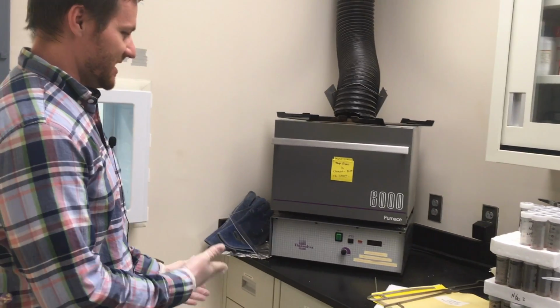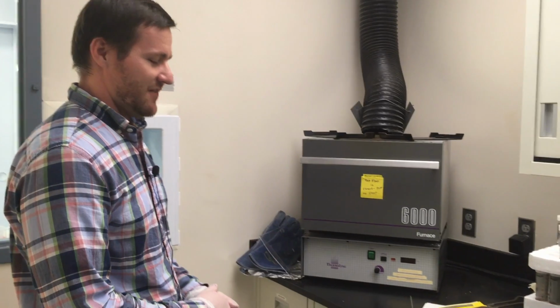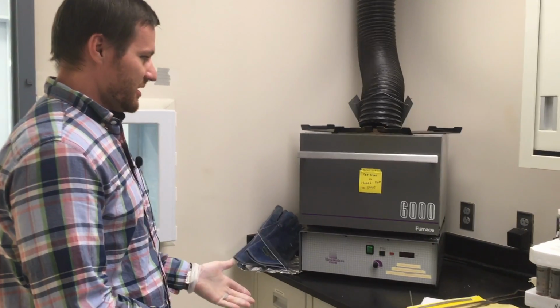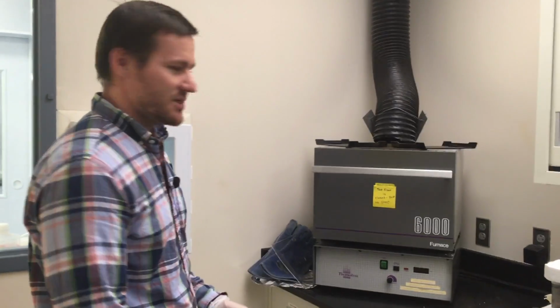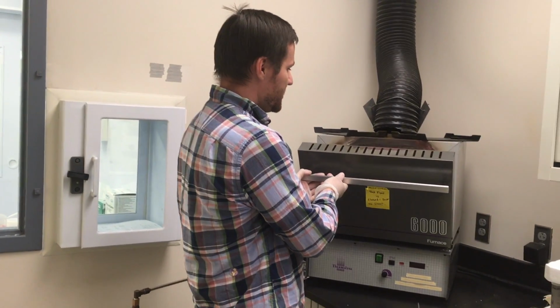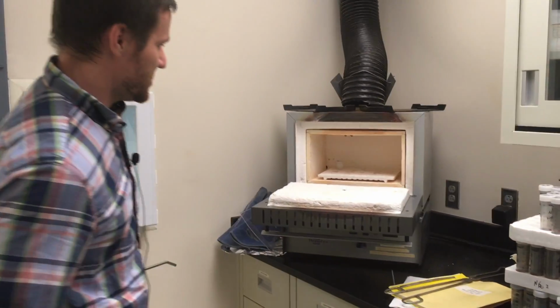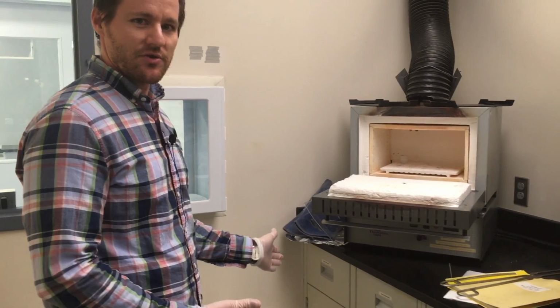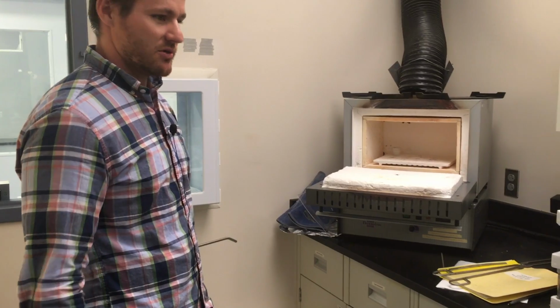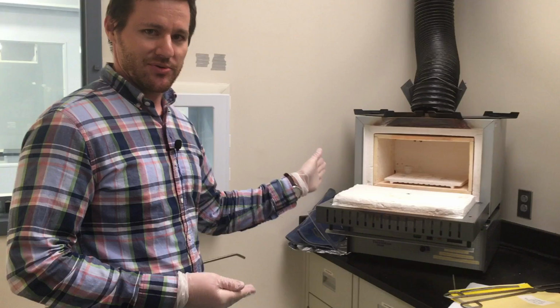And so you just want this to sit for quite a long time as you wait for it to ramp down in temperature. One strategy I like to use is, after it's been cooling in the morning for a couple hours, I'll come back in and slowly open the hatch. And this will allow your samples to cool a lot more quickly. Even at that point though, the crucibles are still very hot. I'll let it sit with the door open for another hour at least. And then after that hour is over, I'll come back in, and my samples should be ready to be taken out. Sample names will be gone.